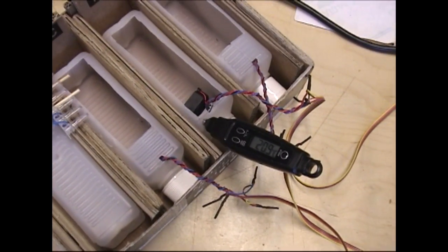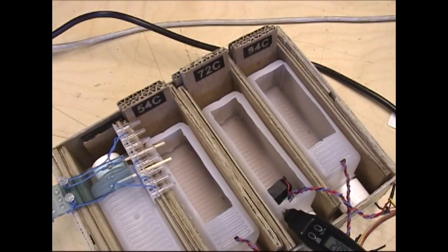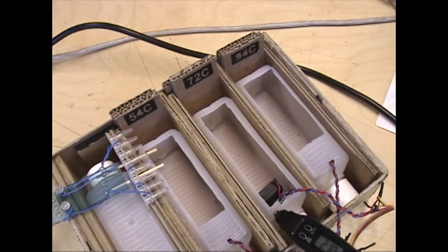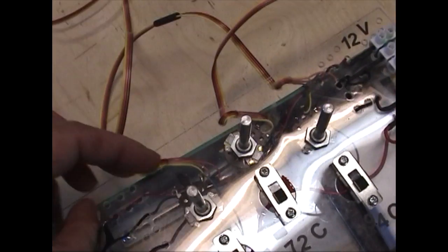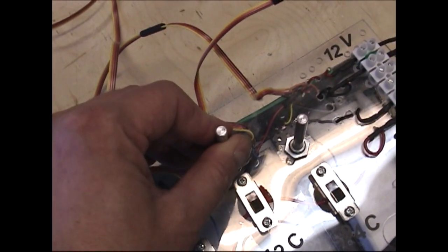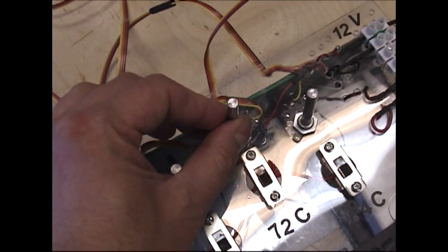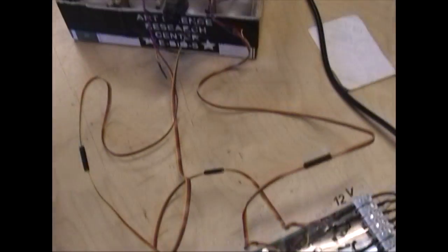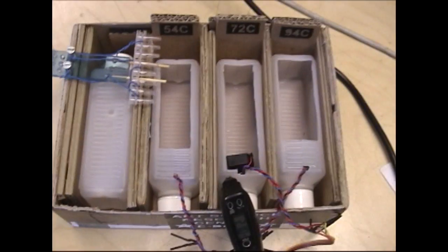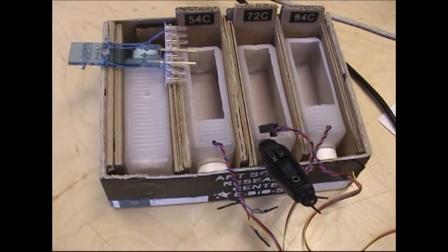When we start heating, at some moment the temperature rises to the level that we need. We have essentially three major levels, 54, 72 and 94 degrees. At that moment, with those resistors we can reduce the heat, and with small increments, to my big surprise, I was able to stabilize the temperature very well, proving that it sits in the isolation box made from carton. And that's it.